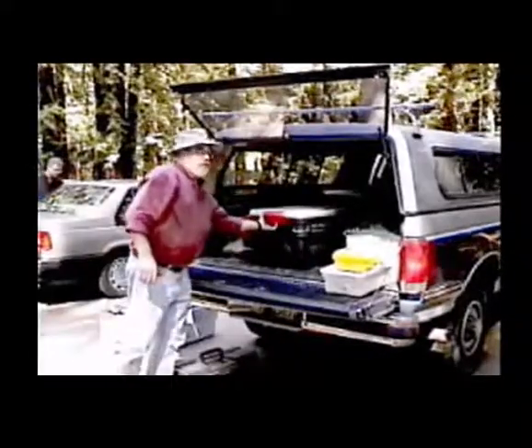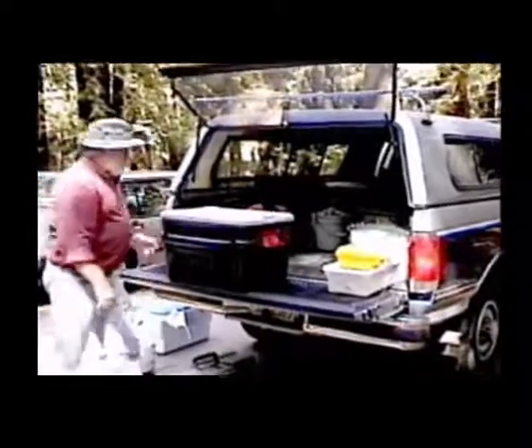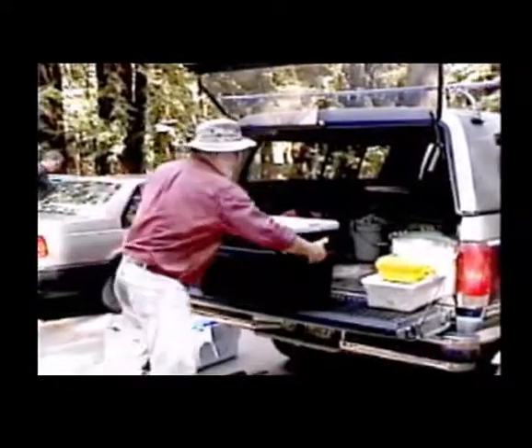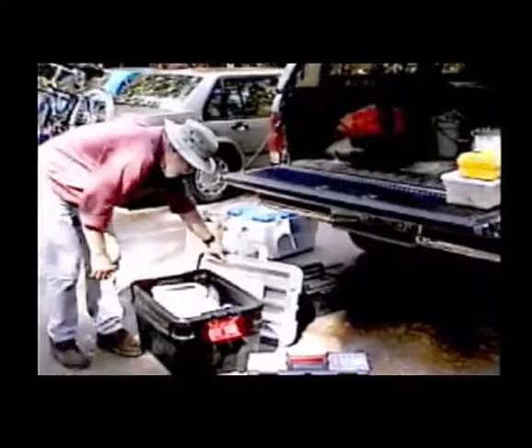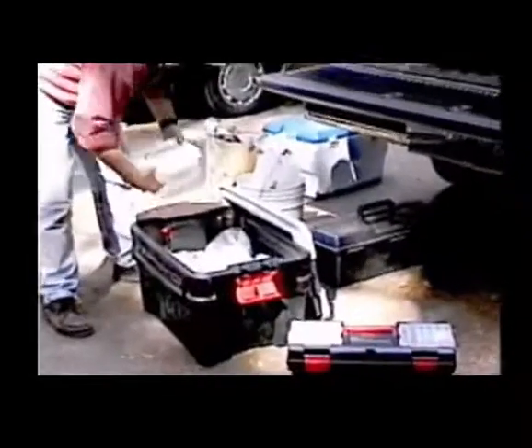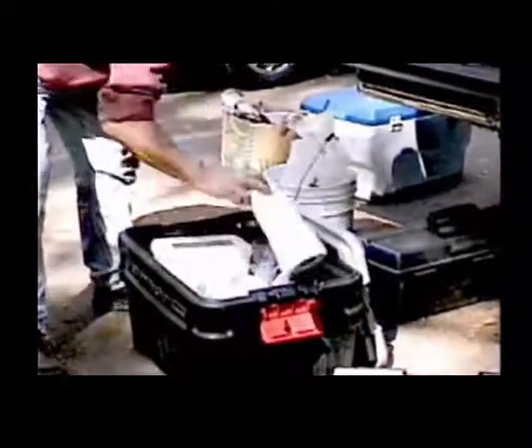Other field equipment. This is the standard large container with a lid. These are very, very good to sit on. They're very strong. You can stack them. And they contain all manner of associated equipment, gloves, wipes, handy wipes, things like that. Anything you want to put in here, this is all our medical equipment, things like that.